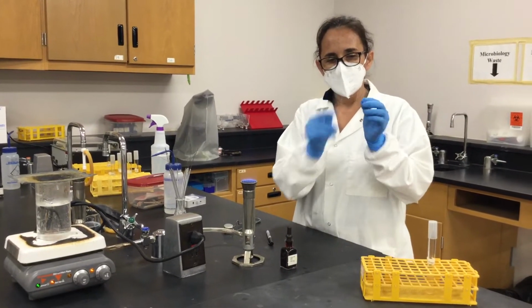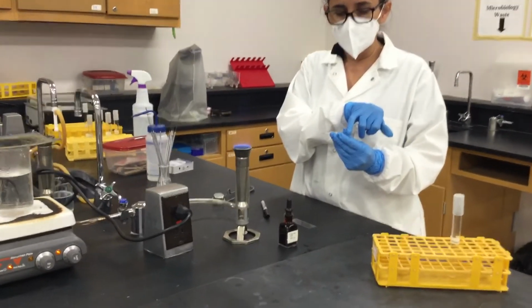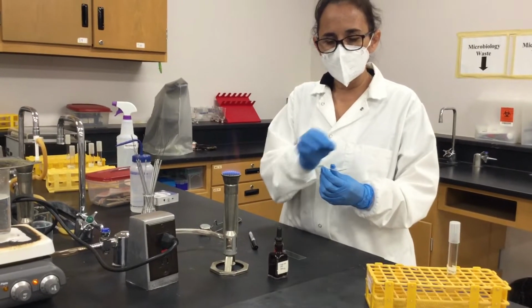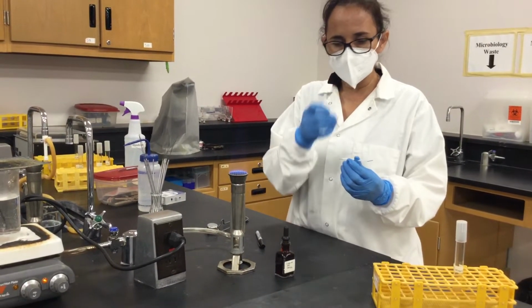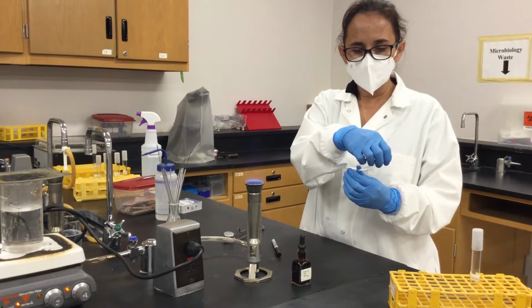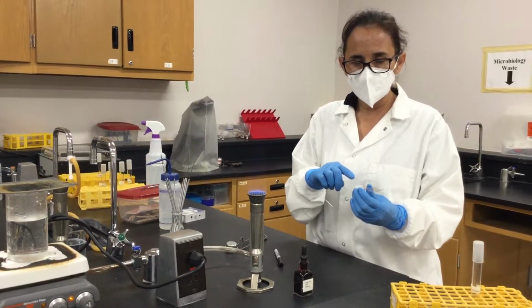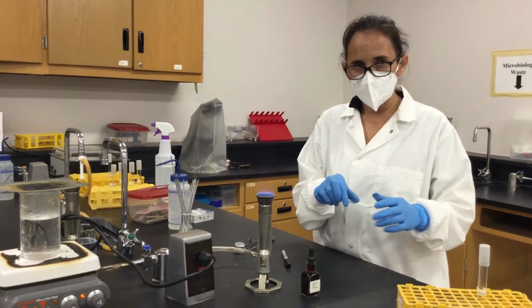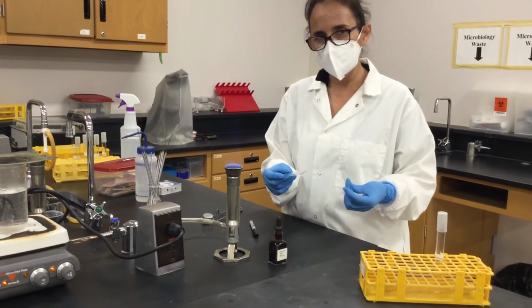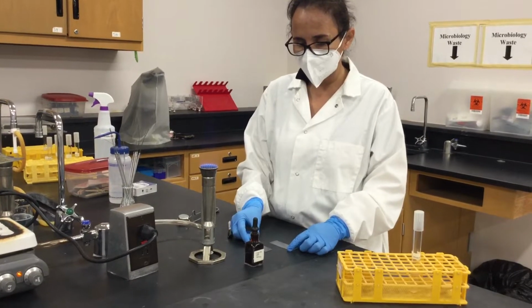glass slides. In this glass slide we're going to add a drop of Congo red in here, and we're going to add a drop of the bacteria. We're going to make a homogeneous mixture, and then with this second slide we will grab part of this mixture and drag it until the end of this glass slide so we can have the smear. And since this is a capsule stain or negative stain, you don't require to heat fix your sample.